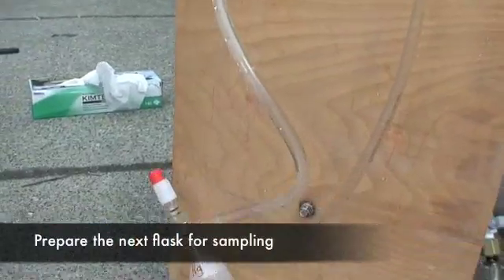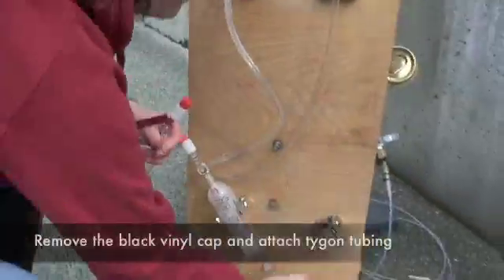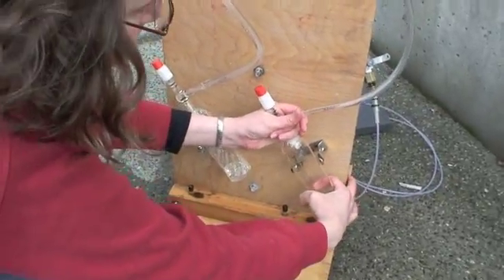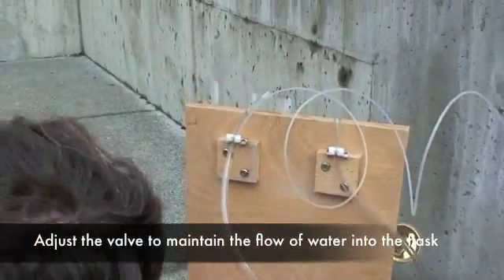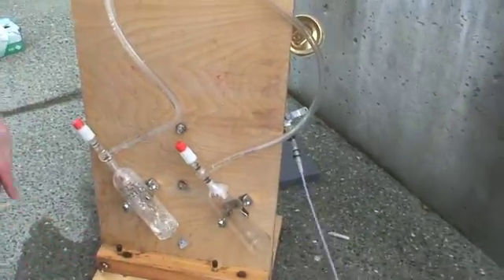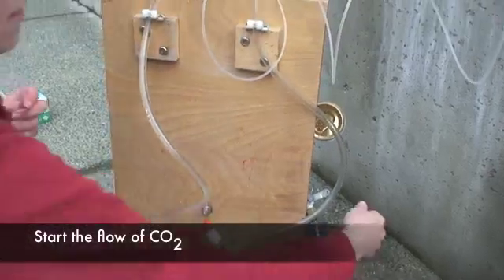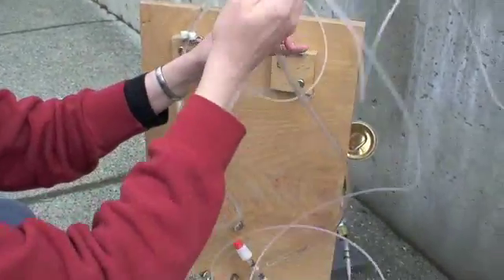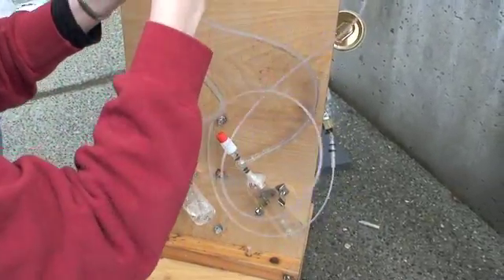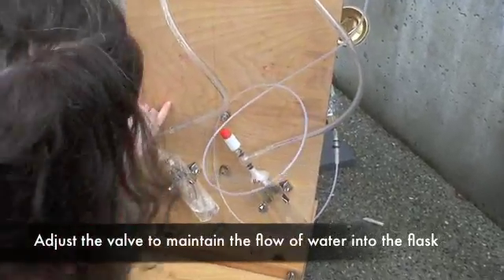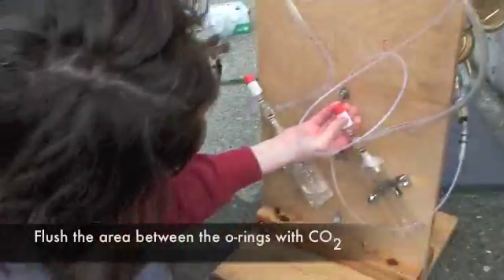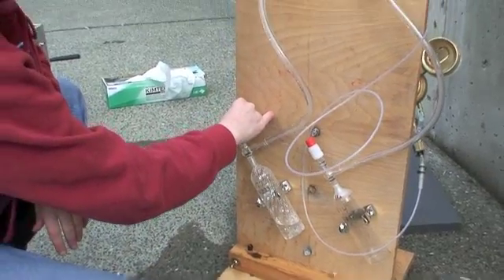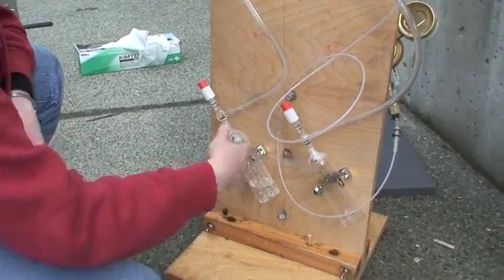Now while this one is sampling, start another one. We often take a duplicate, so this is convenient to get the next one going. You can see this is starting to rise again, so I'll just crack that open a little bit more. And check CO2. Expose that space to the CO2. Now we still have some time for this to fill while this is all flushing.